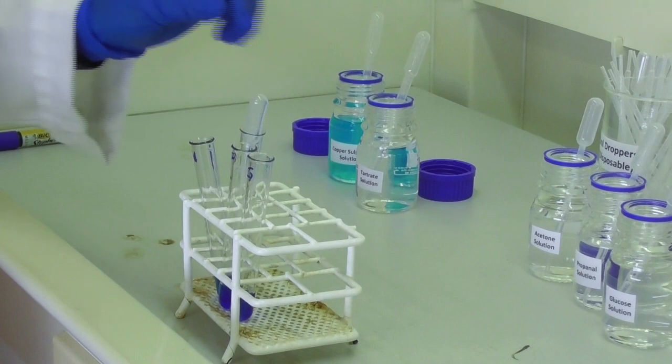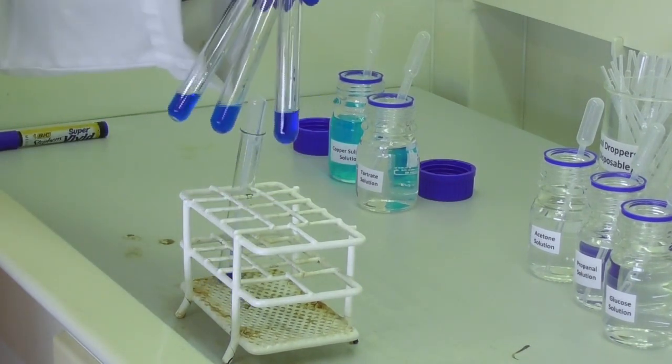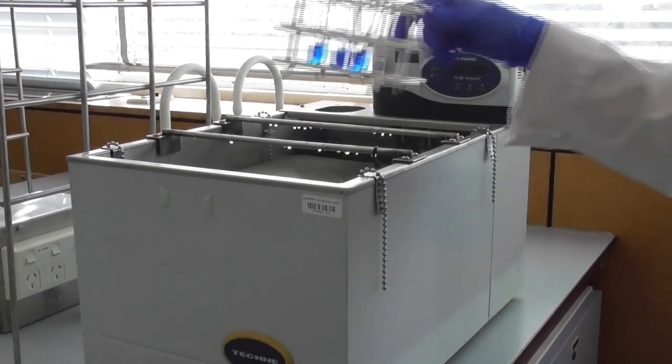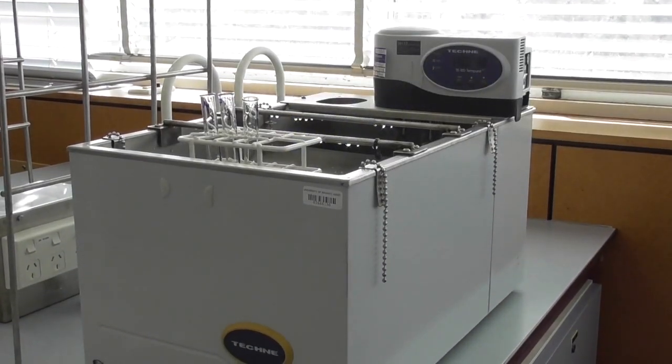After adding the reagent to all three test tubes, we give them a good shake for mixing. And then we heat them for two minutes in the water bath at 60 degrees.